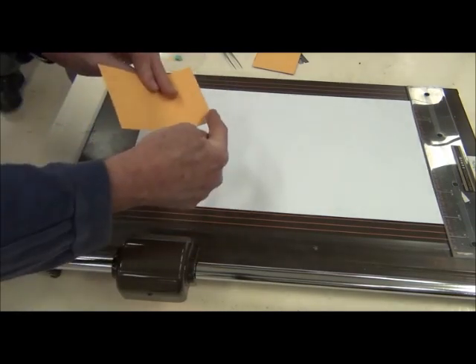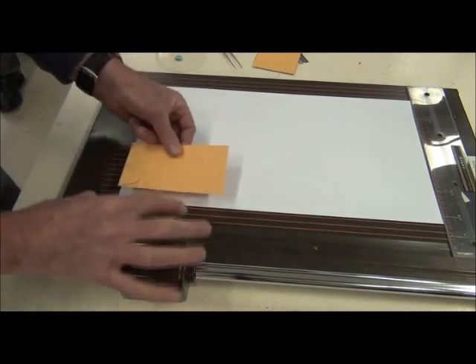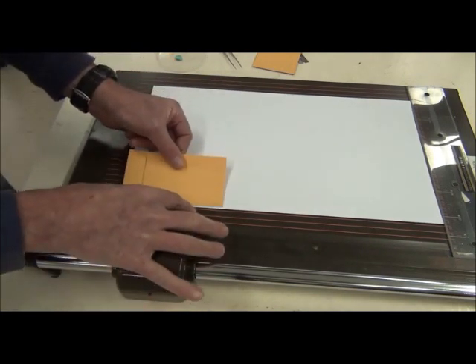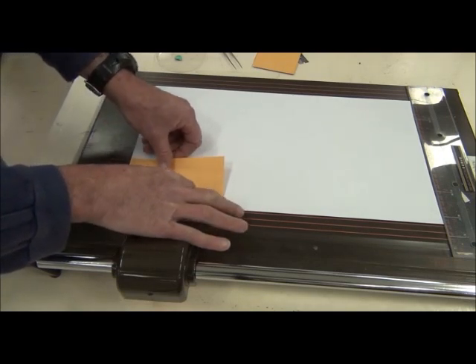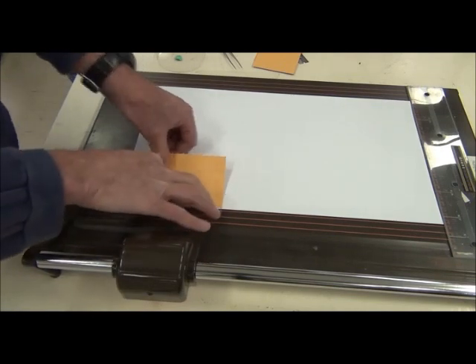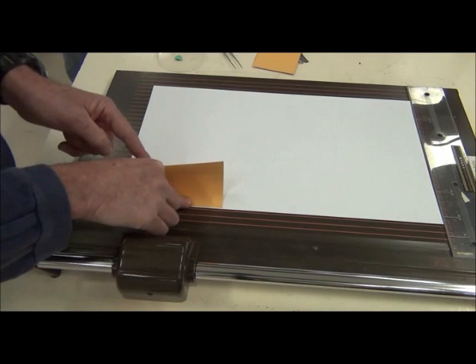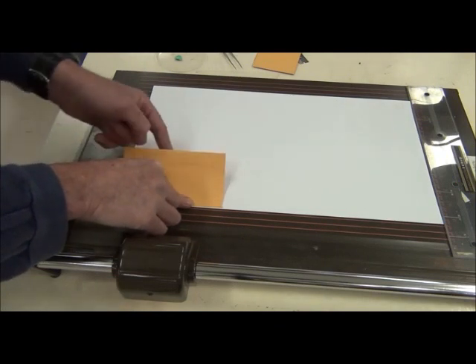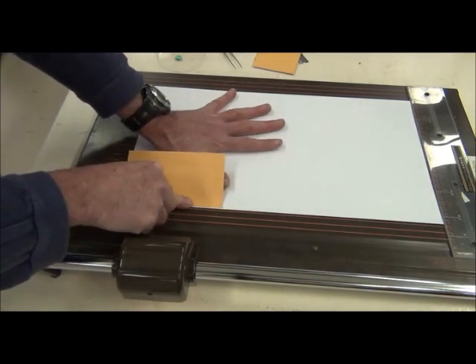I'd put a little bit of glue along the right hand edge and I would just move that into about a millimeter or two in from the bottom and the side edge, rub that down and then that's there. And the beauty of doing it that way is if the specimen is fairly large you can flip this over the specimen. So it means you can use this whole area just as I'm showing with my hand.